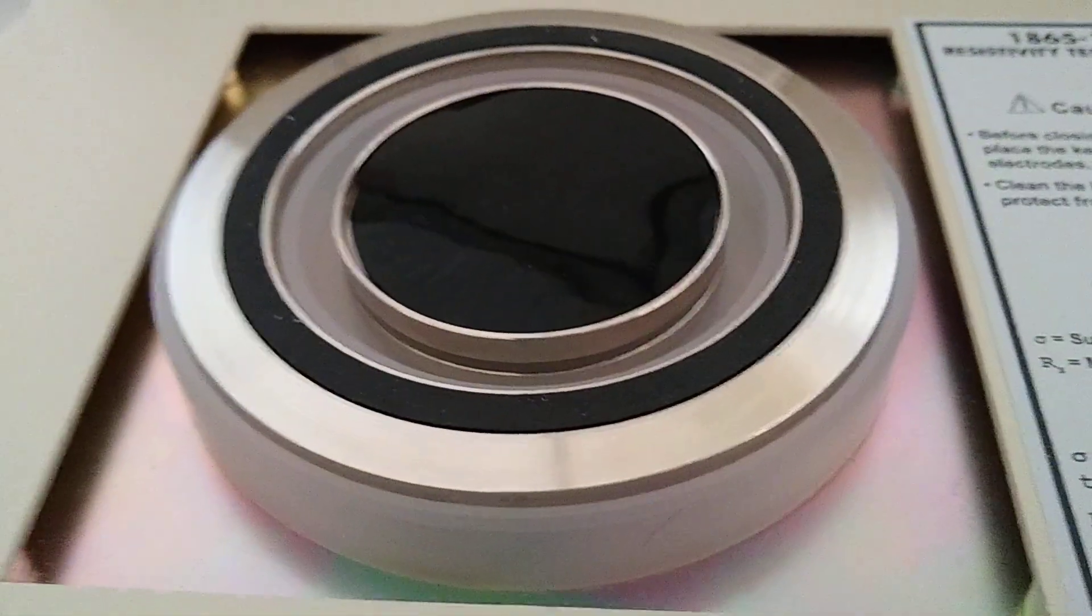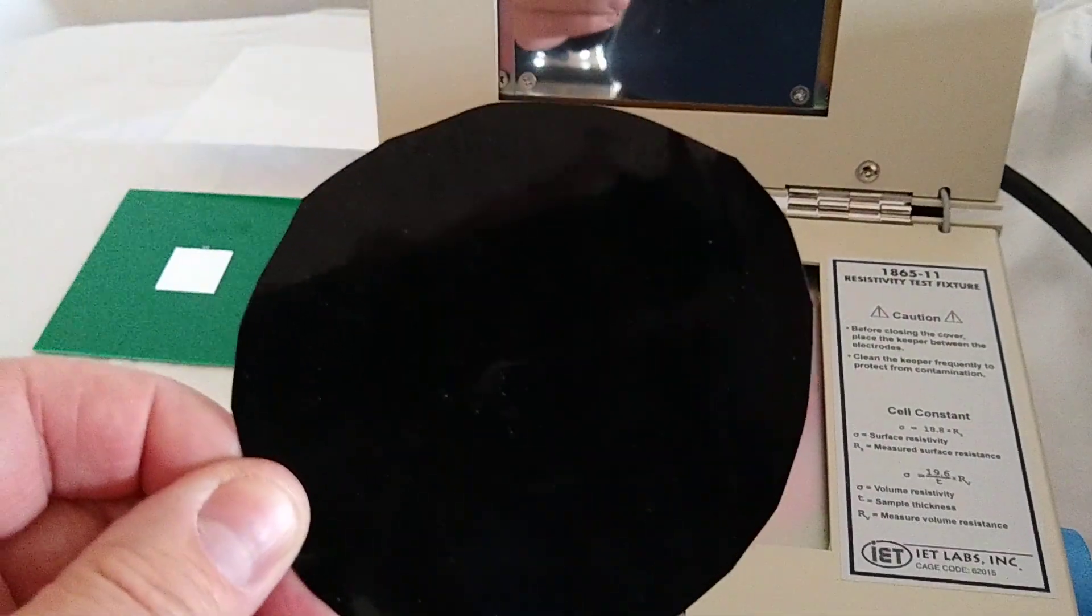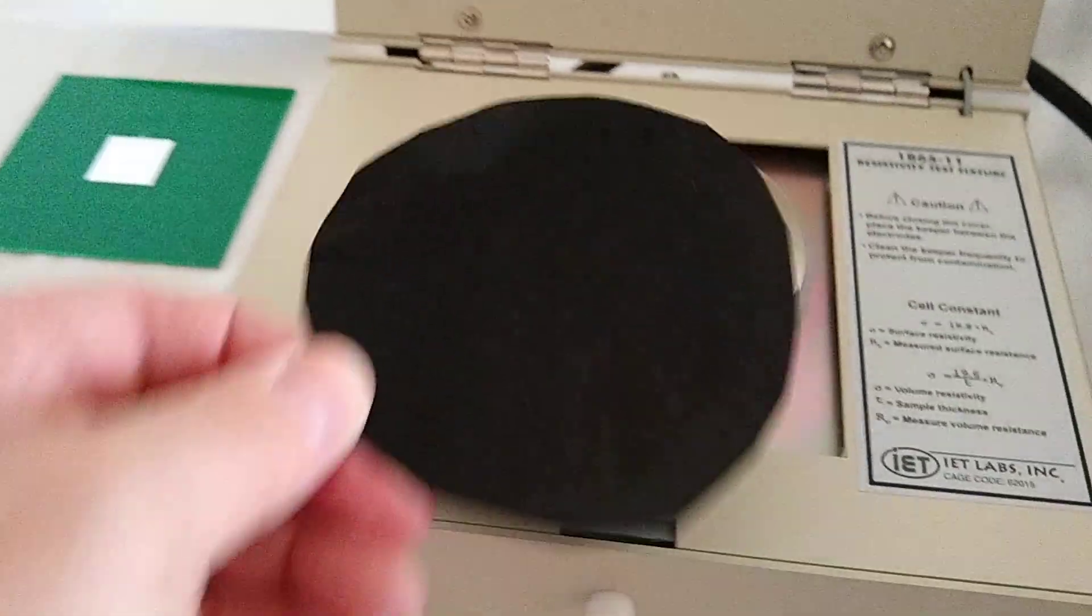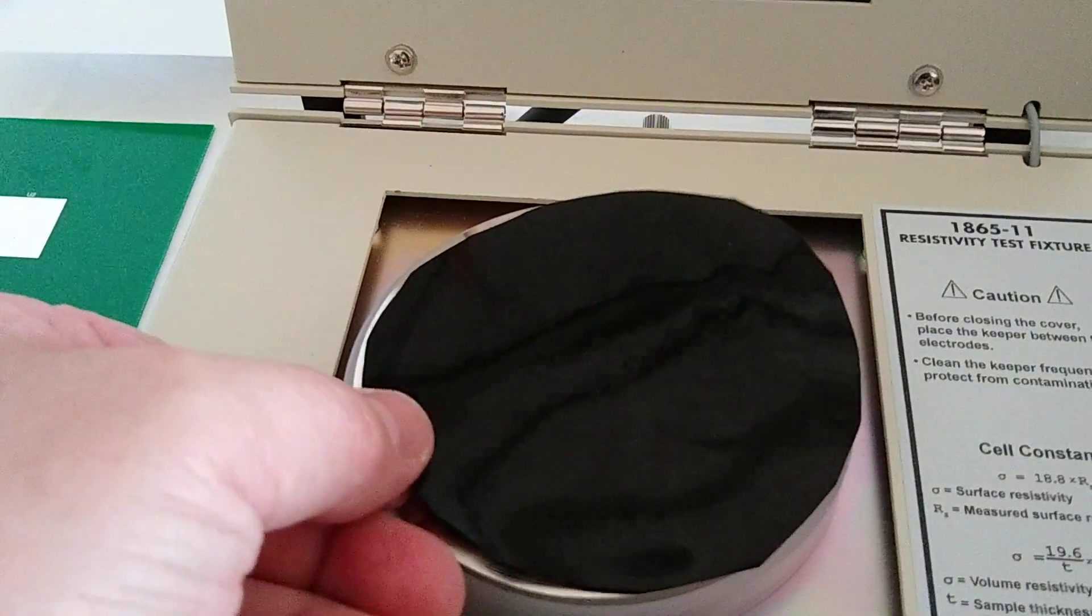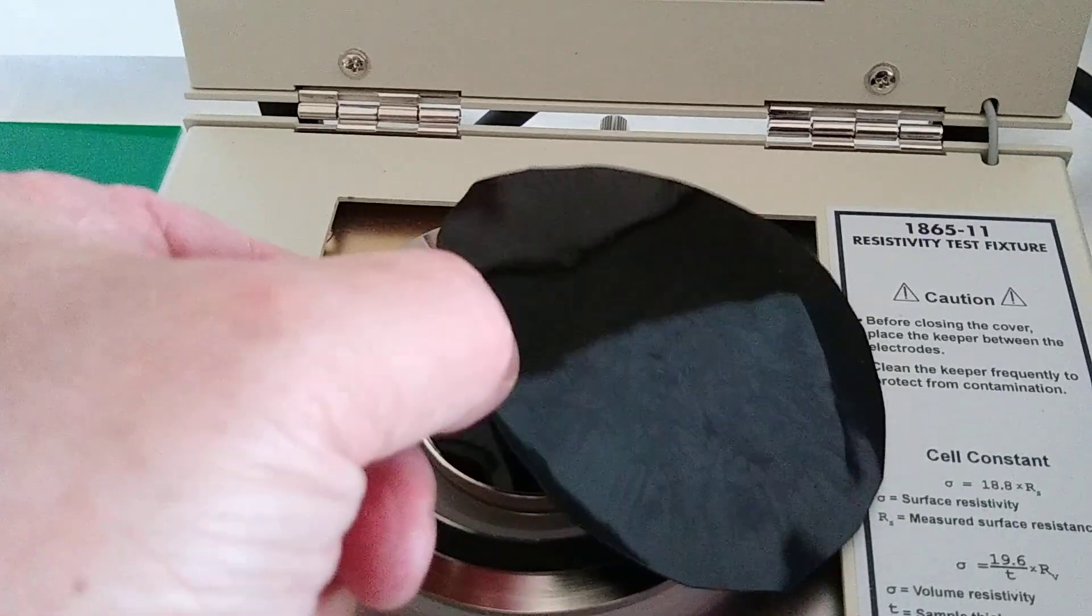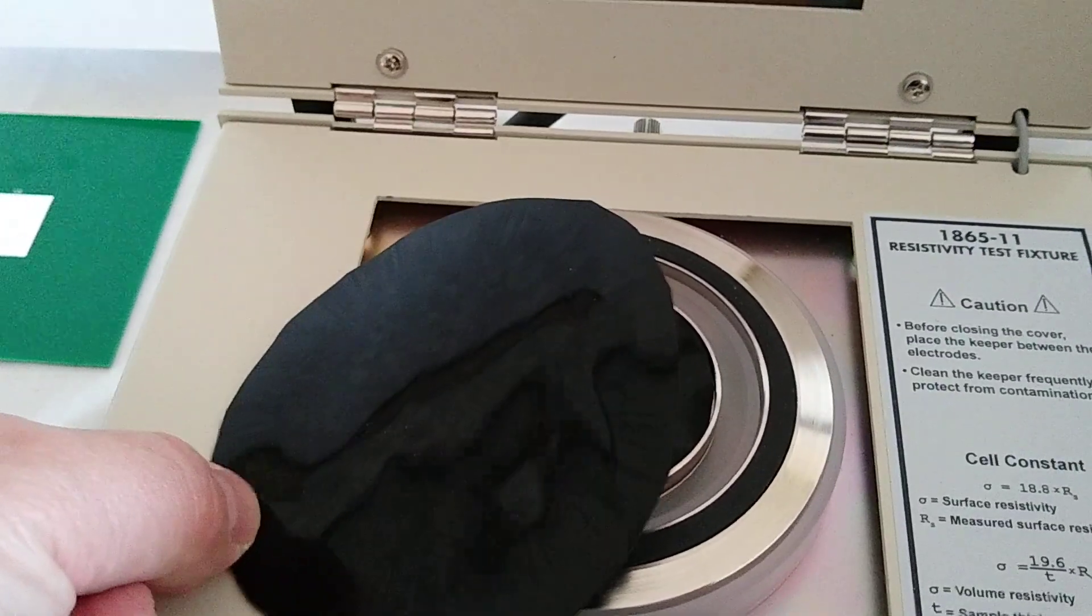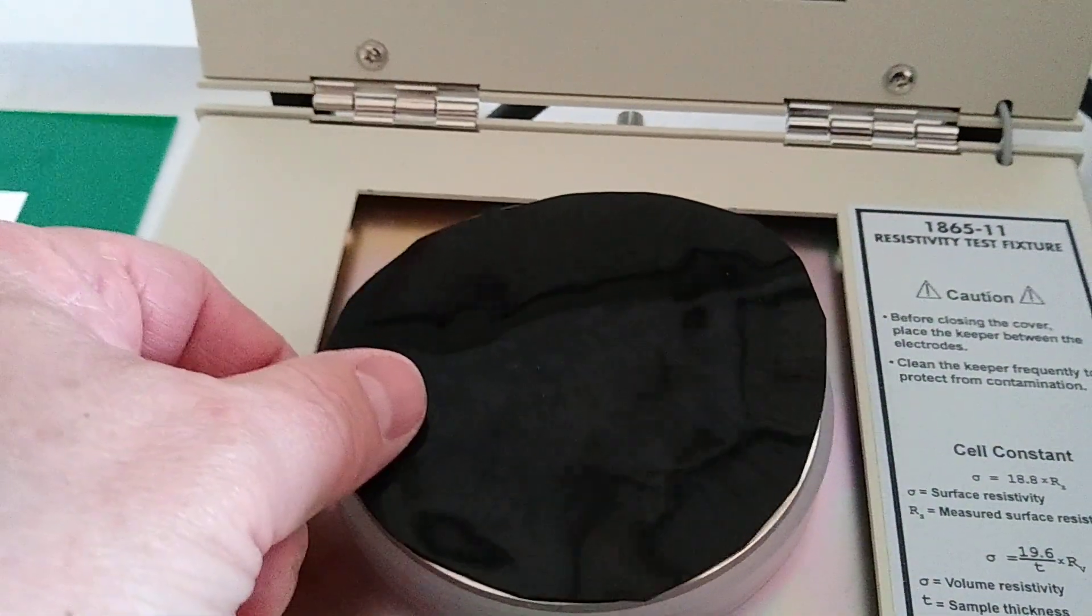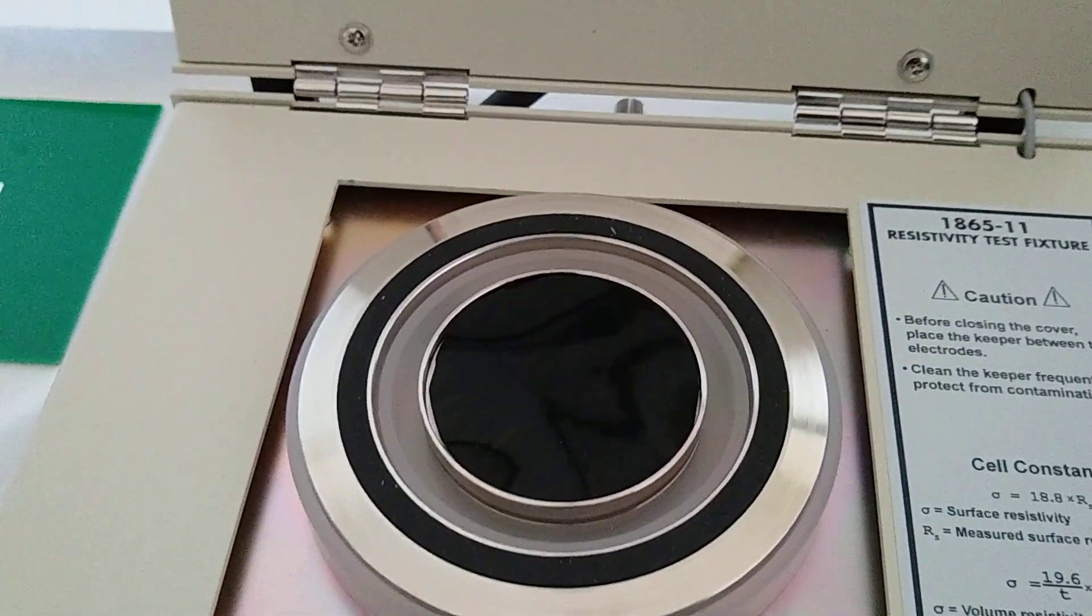Options for placing the sample into the cell. If we have, ideally, a round circular sample, roughly appropriate to cover just the electrode. At no time do we want it to cover over or over on so that we're touching the beige paint. It has to just basically cover just the electrode surface.